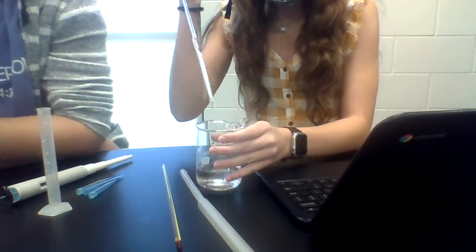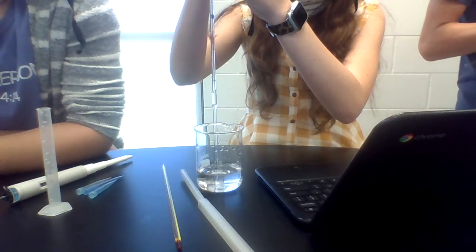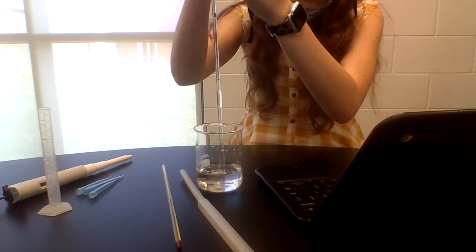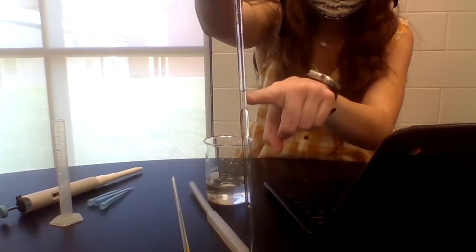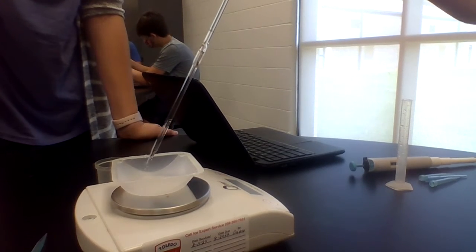Okay. The next pipette, when it talks about pipette, they're referring to the glass tube. When it talks about micropipette, they're referring to the thing that's going to cost $300. Okay, that was pretty good. Now it's on the line again. Wait, this way. We're gonna do this through the whole thing.